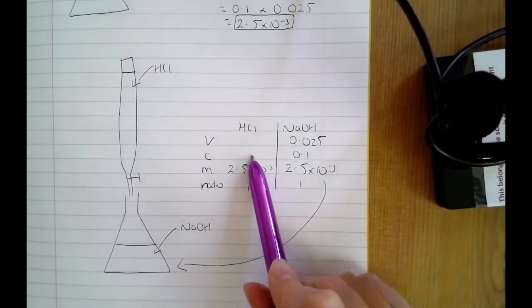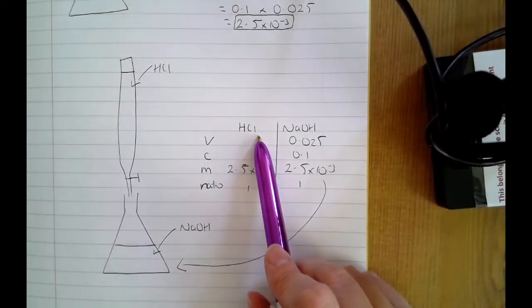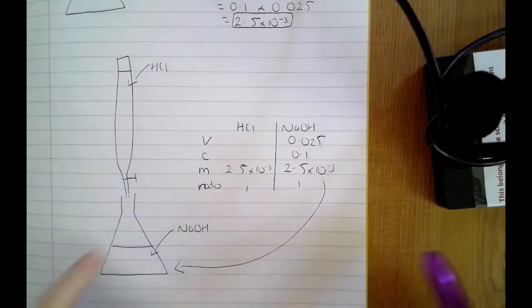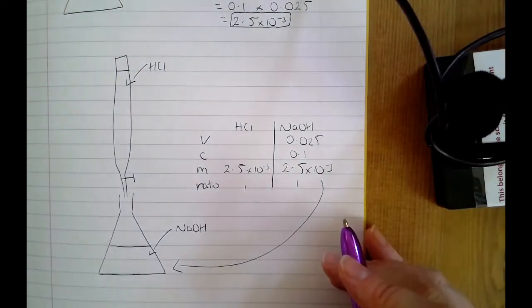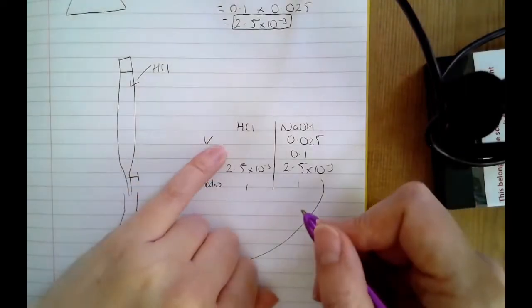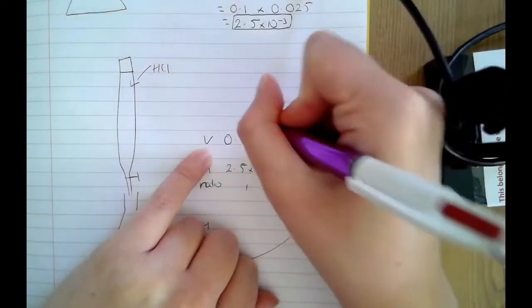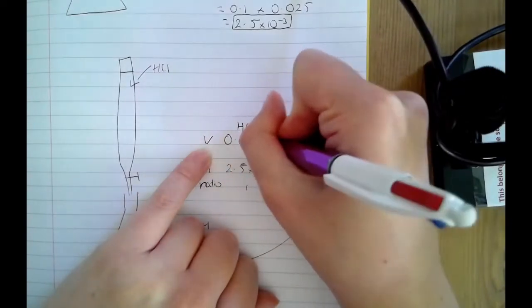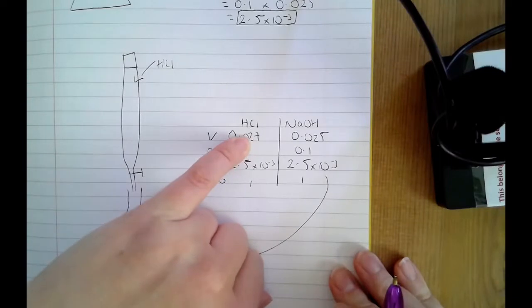And what I would need to do is repeat the titration a number of times in order to get concordant results, so volumes that are within 0.1 centimetres cubed. But let's just say once I've done that, I've got my concordant results and I've got the mean, that the volume of HCl required, let's just say, is 0.027 decimetres cubed. So that's the volume of HCl required.